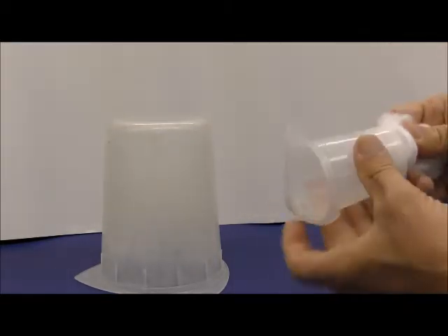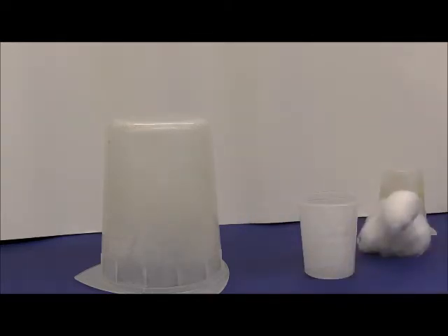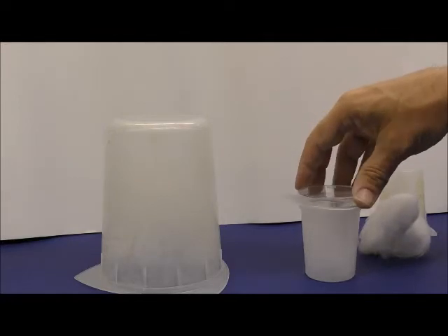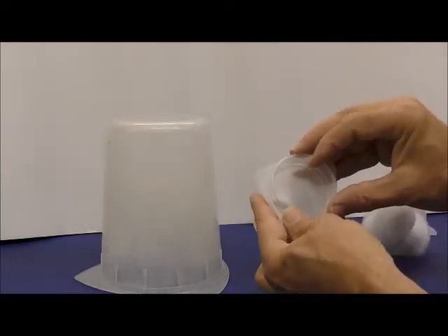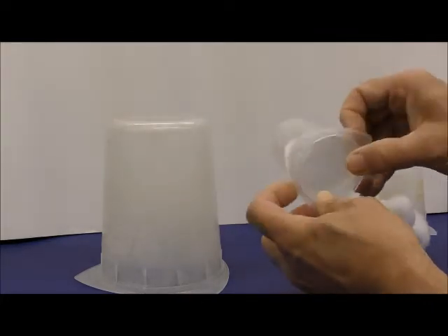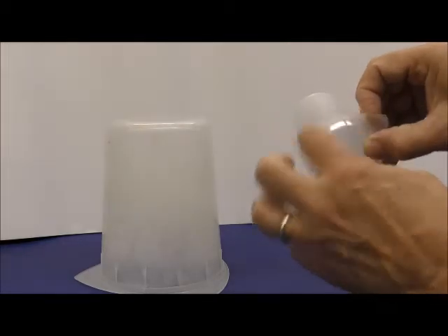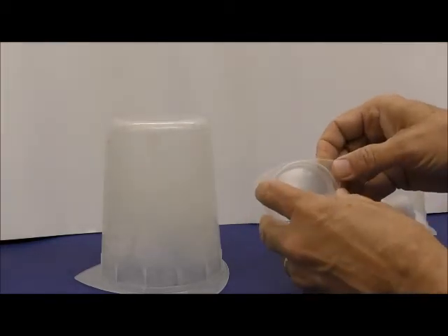All right, and then with these, one can actually put dishes on top that will collect the eggs. Now you can see that this dish is just barely covering the edges here, and you have to be careful because any gap will allow the flies to come out.